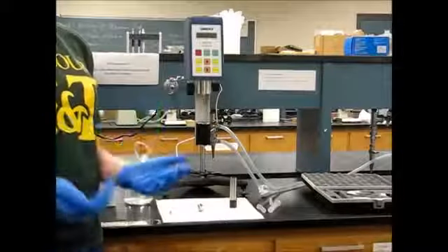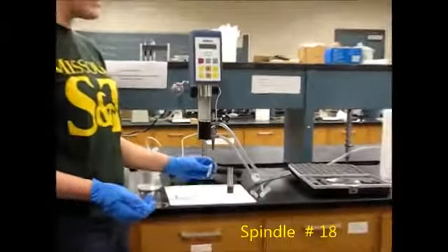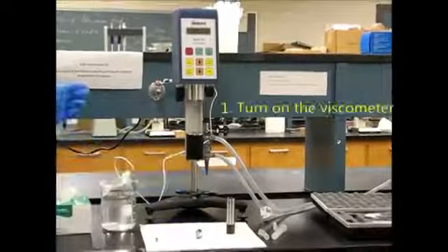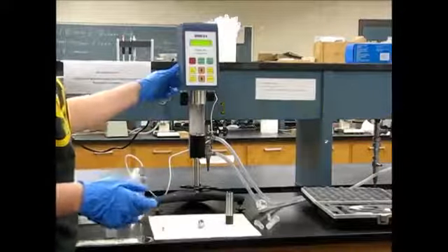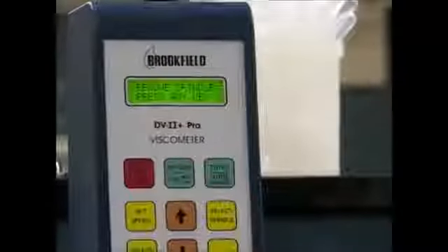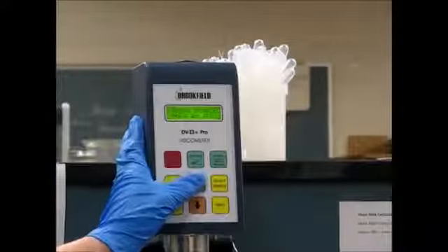So for the purposes of this experiment, we're going to use spindle number 18. It has an 18 on its stem. So the first thing that we're going to do is turn on the viscometer with an on-off switch on the back of it. And we're going to follow the directions on this keypad. So it tells us to remove the spindle. We don't have a spindle attached, and then it says press any key. So I'm going to go ahead and press a key.